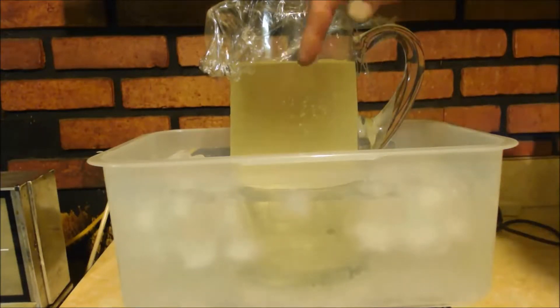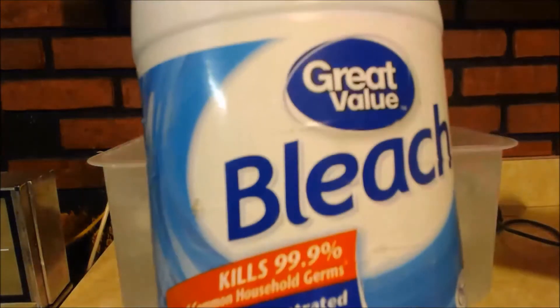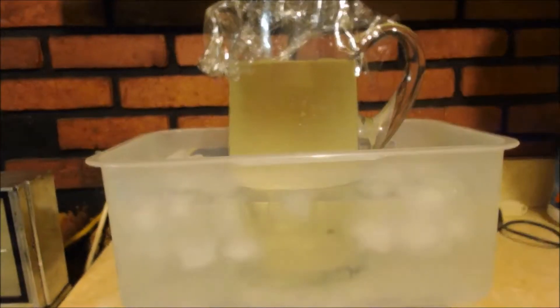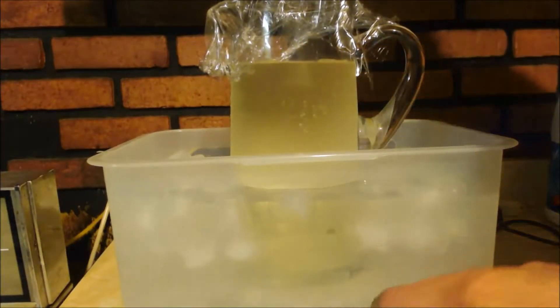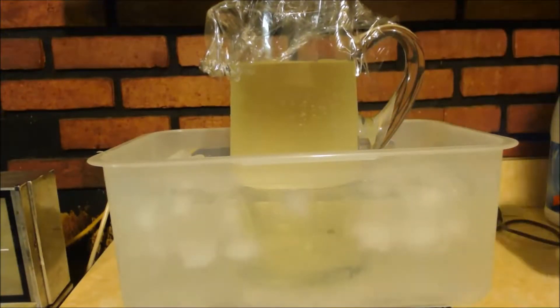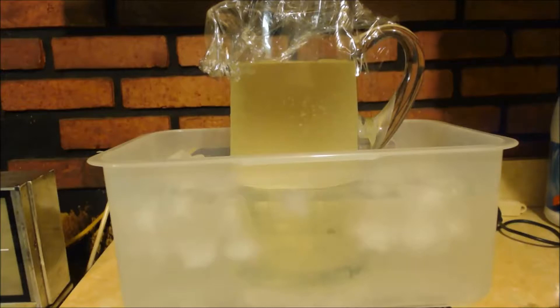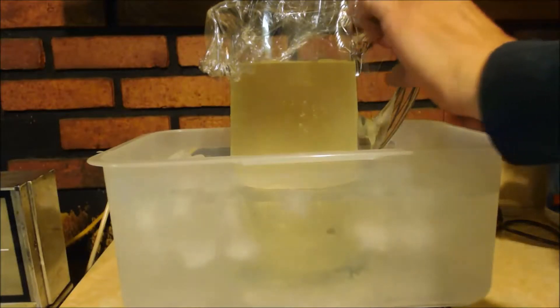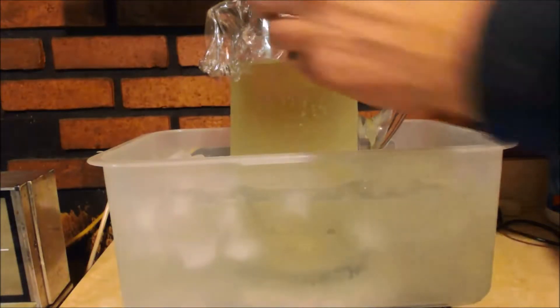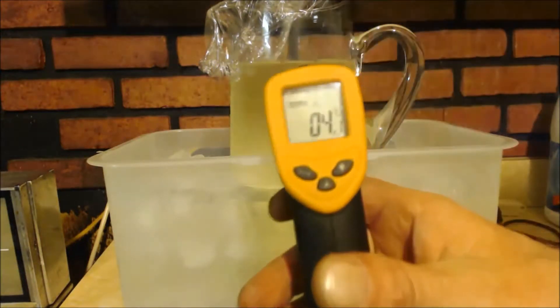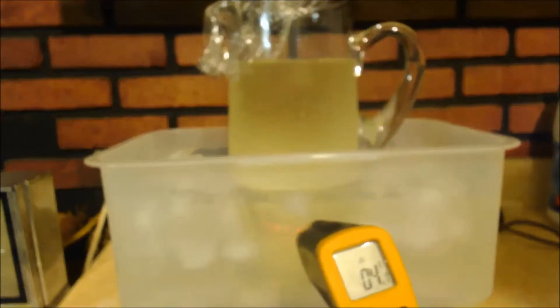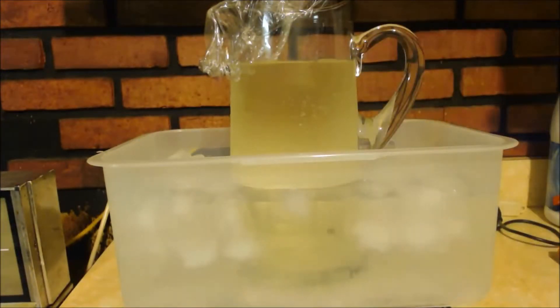Alright, I got about 2,300 milliliters of Clorox. The cheapest, great value bleach. That's all I have left. I didn't titrate it or anything, but you can see how green it is. I got my stir bar on there. I have 60 milliliters of acetone here. I want to add it slowly. A little bit at a time. I cooled everything down. That's at like 4 degrees. Alright, so I'm going to add it in.